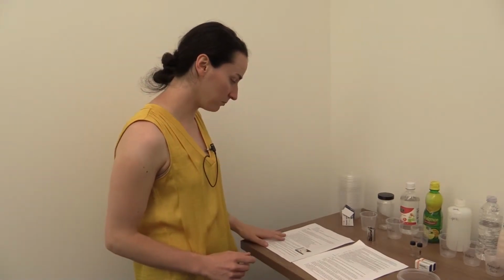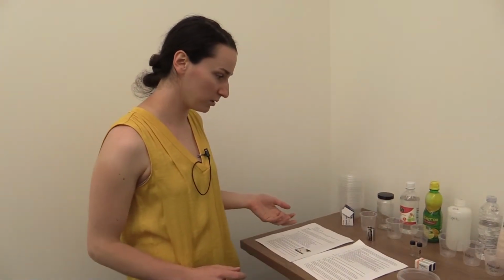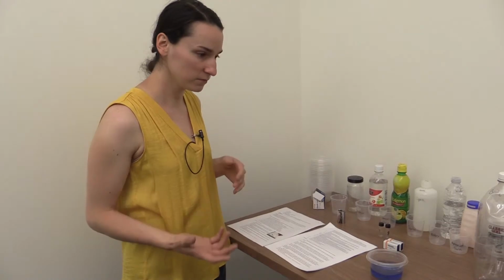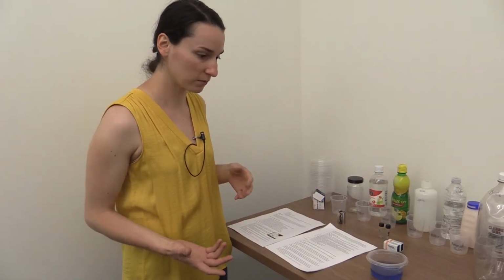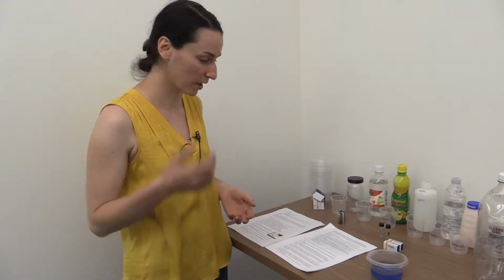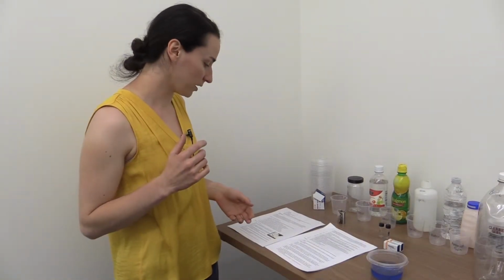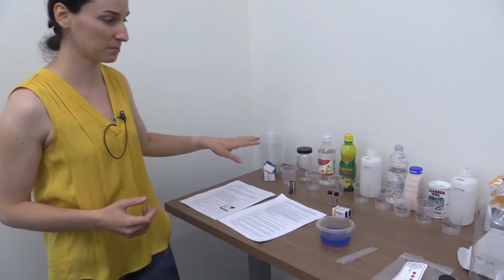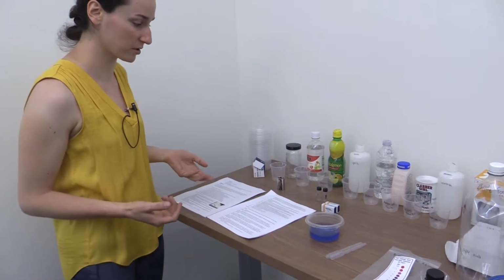So the entire point of this lab is to show electrolysis using pH indicator to show which electrode is producing which gas. And so we are going to have a bunch of household chemicals, and that is going to actually take up a lot of the class time, having them make their indicator solutions.